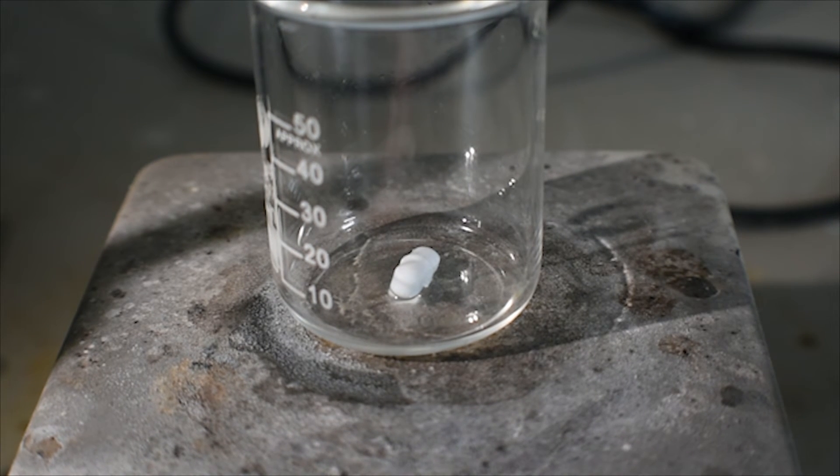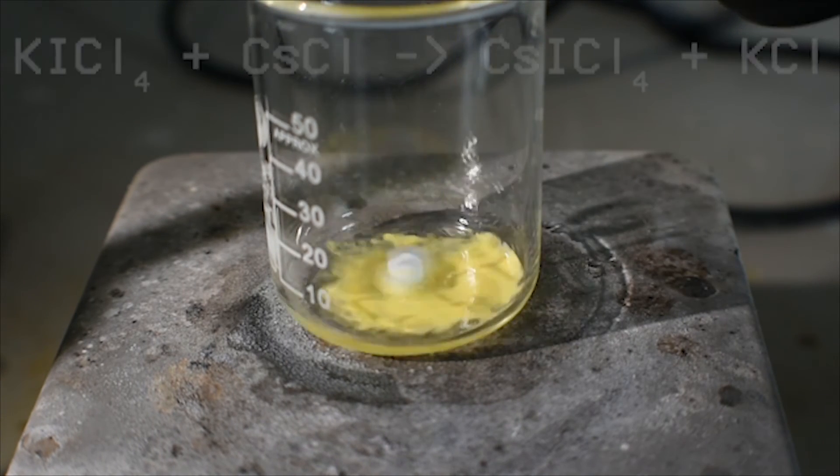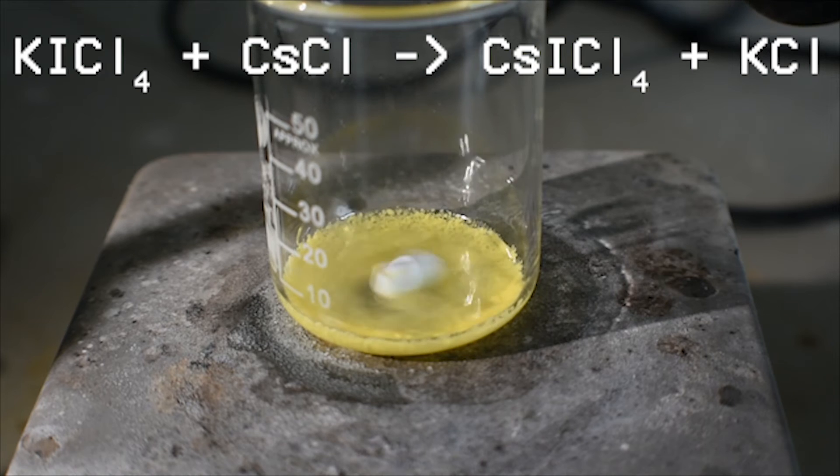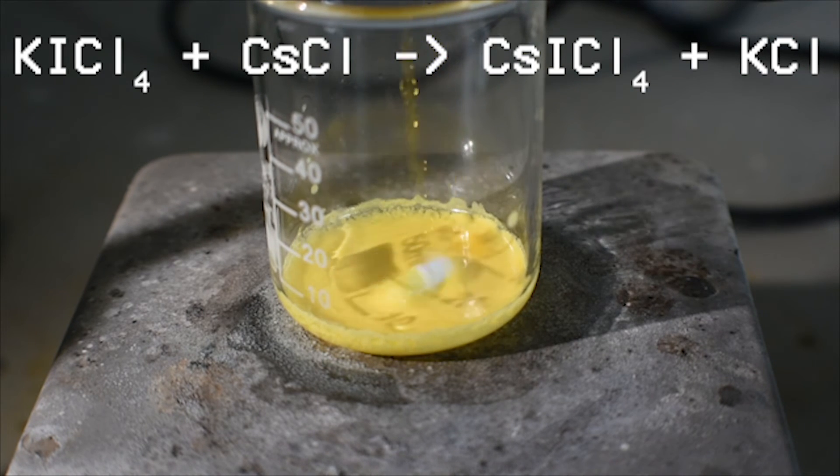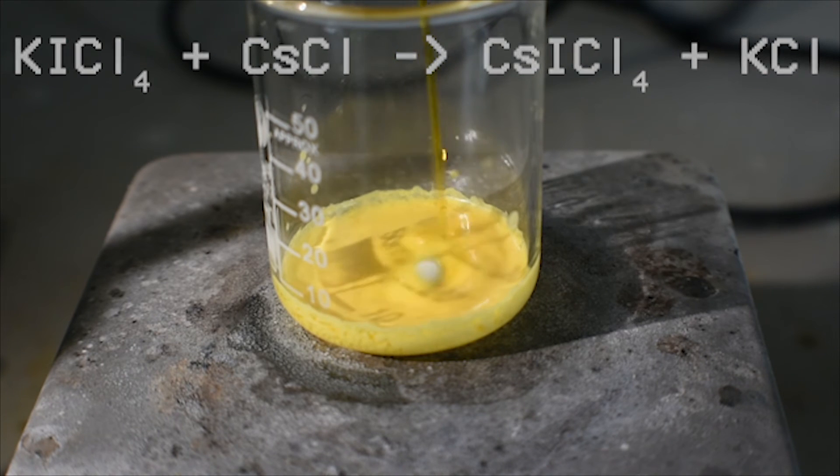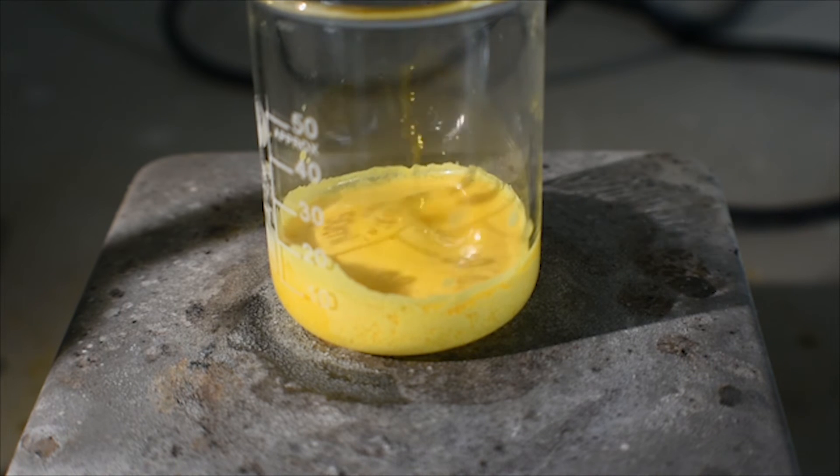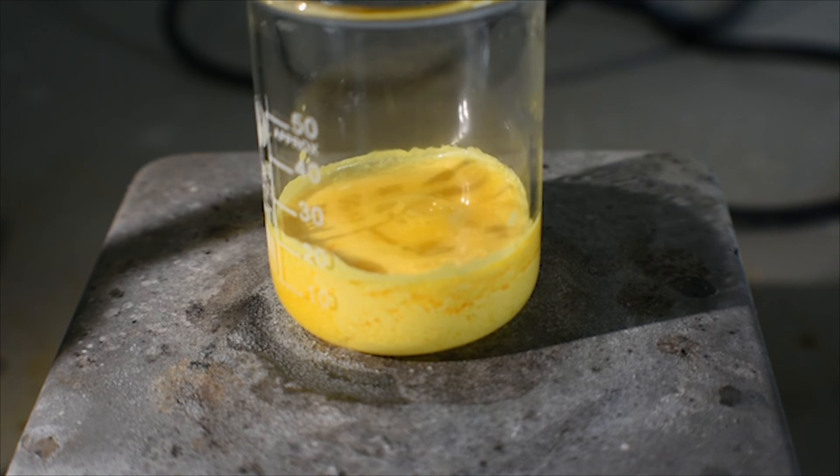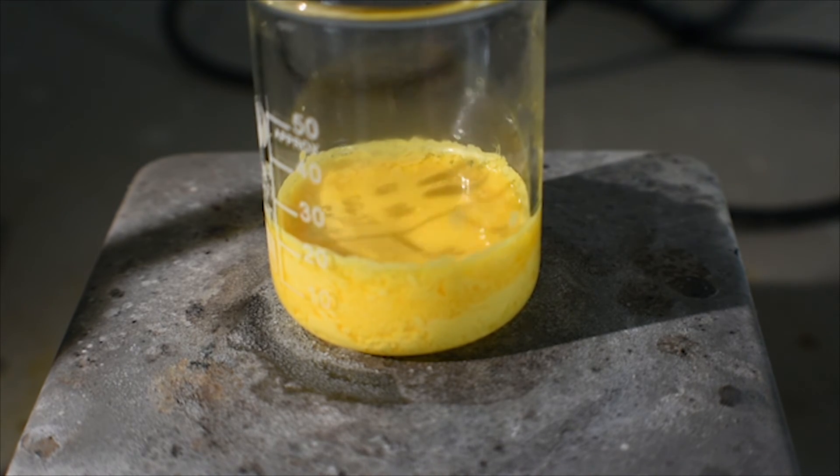I'm going to turn on stirring here really quick. You can see that the mixture is getting extremely thick with precipitate. That is what we want to see.